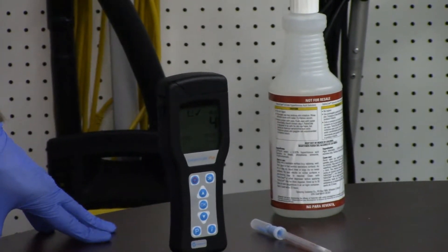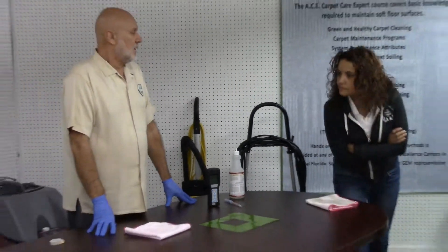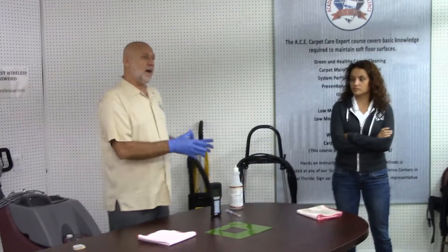What does the meter say now? Four. On this manufacturer's chart, anything below ten means I can prepare food on it safely.